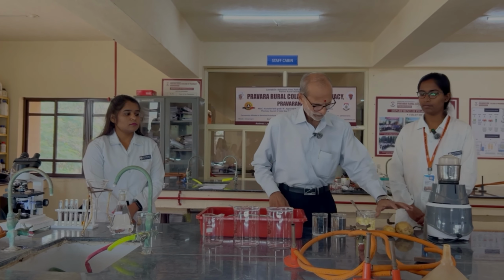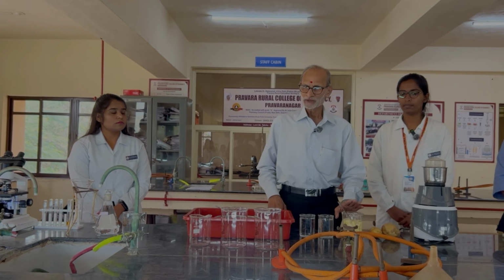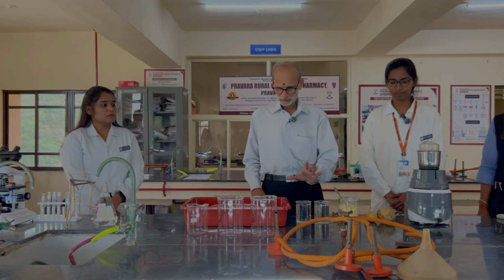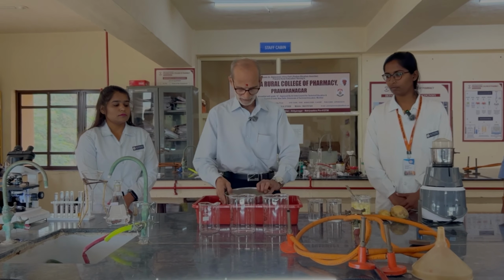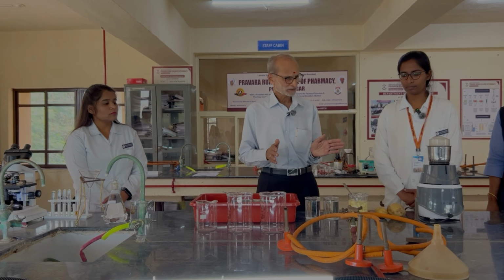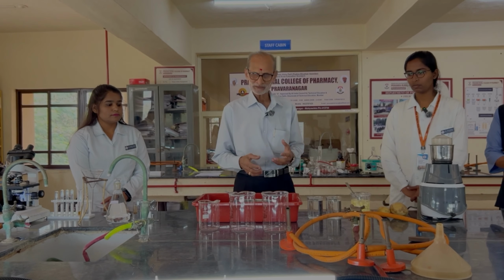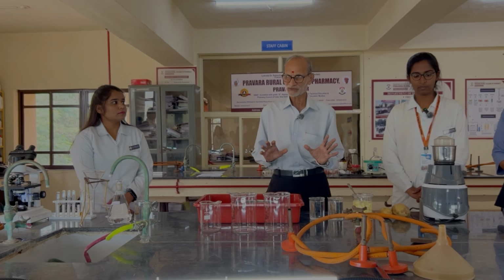And here we have a potato, and these are the peeled potato pieces. What we are going to do is make a pulp in a mixer. Bhakti is going to do that, and thereafter we'll be passing it through the mesh. Now the mesh which we are using is about 60 mesh, and the starch grain of the potato is about up to 100 micron in diameter, so it will pass through it, whereas the cellulosic material remains behind. Potato contains around 17% of starch.